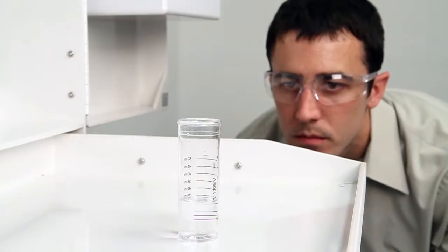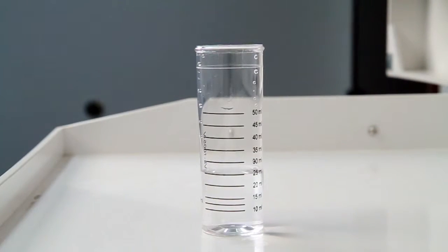When performing a drop count titration, a white background can provide contrast to better see the color changes. A cabinet tray or white paper towel can provide that contrast.